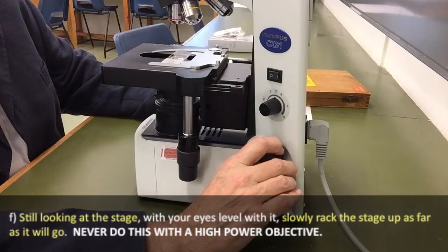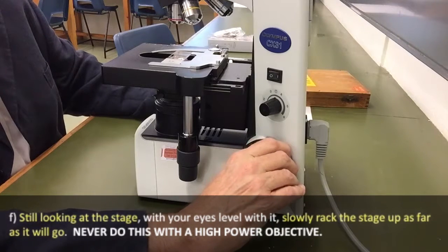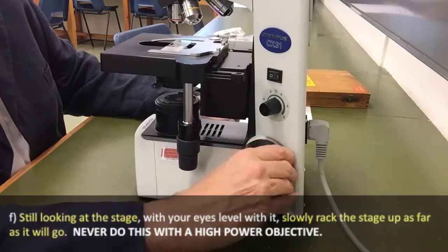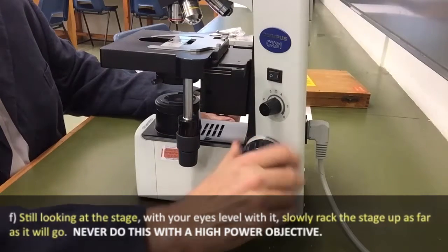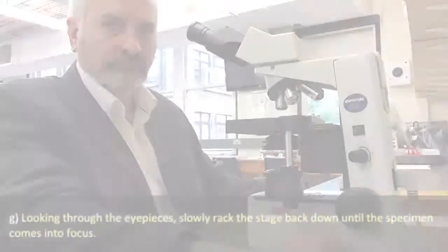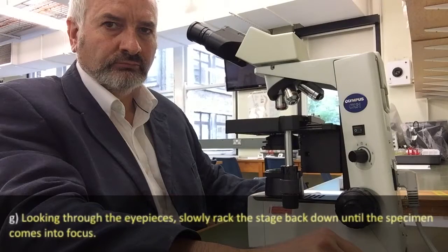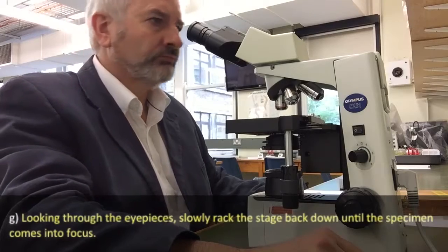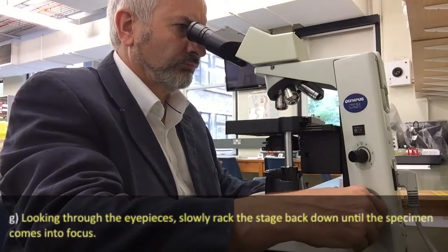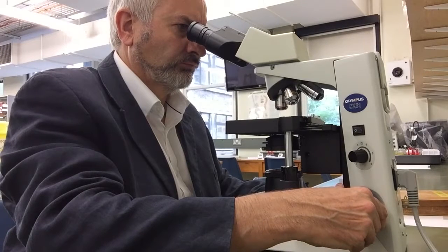Now, still looking at the stage with your eyes level with it, slowly rack it up as far as it will go. Never do this with one of the higher power objectives — only with a low power objective. Now looking through the eyepieces, slowly rack the stage back down using the coarse control and then the finer outer knob until the specimen comes into sharp focus.